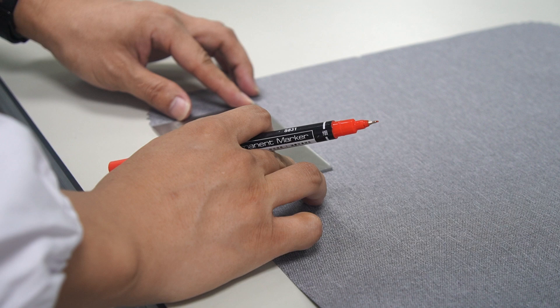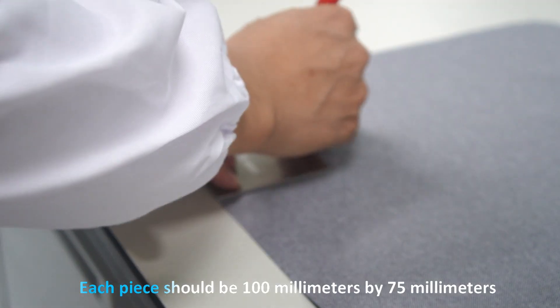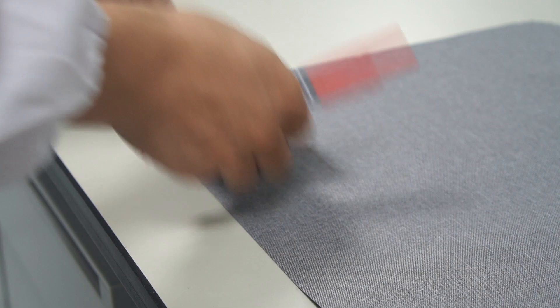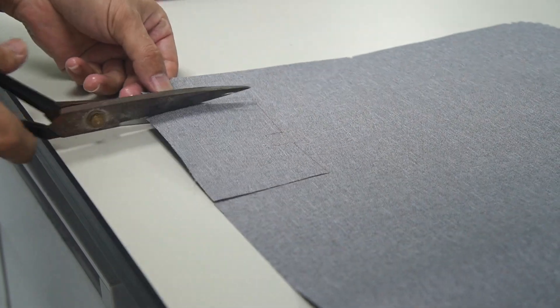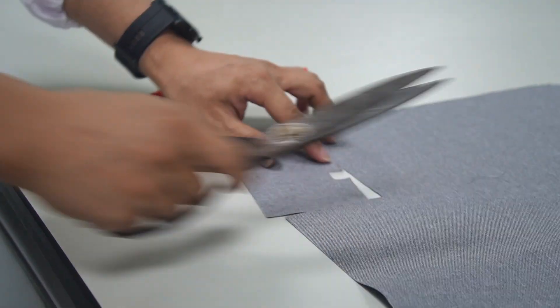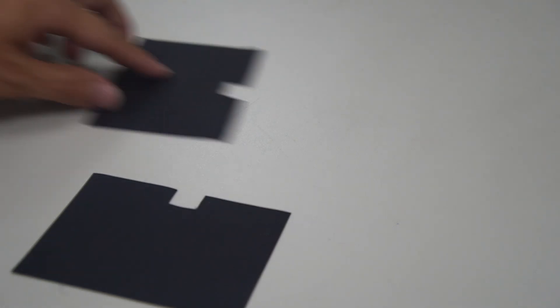To do this, we place the tear template on the fabric and mark the size. Each piece should be 100 mm by 75 mm. Then we cut out a small piece, 15 mm by 12 mm, from the top center of each sample. We'll do the same for both warp and weft specimens.